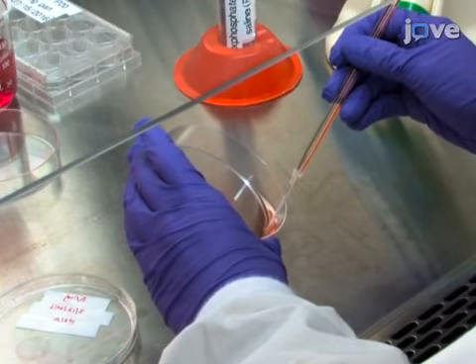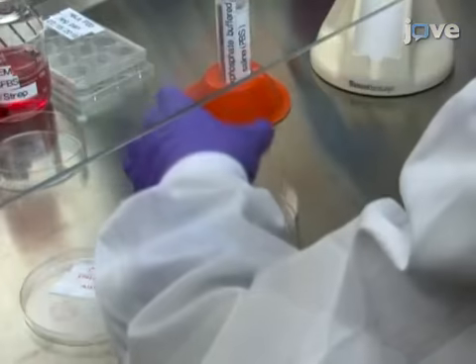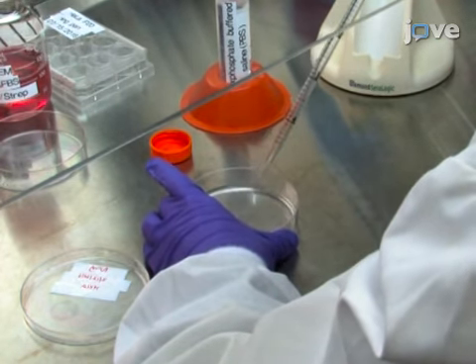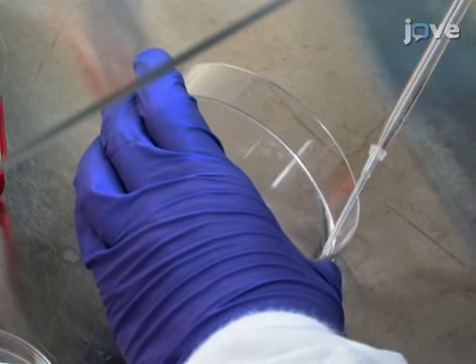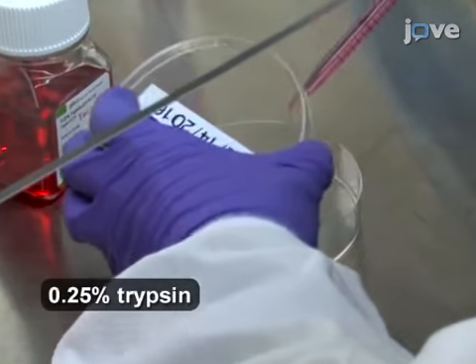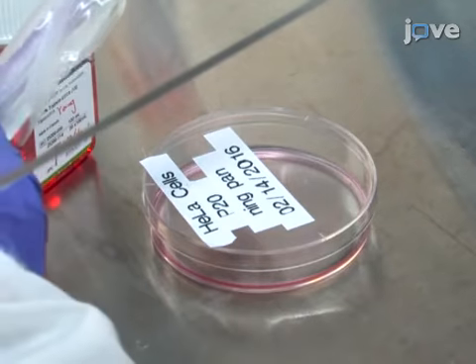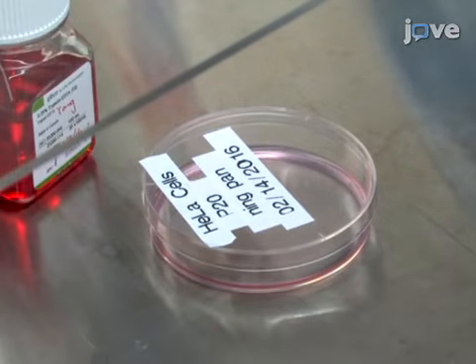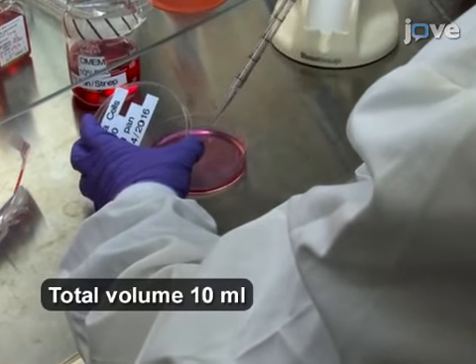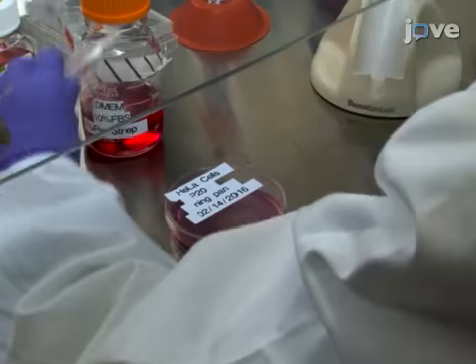Perform cell passaging in the cell culture plate. To do so, aspirate the growth medium and rinse the cells with 5 milliliters of 1X phosphate buffered saline. Remove the PBS using a sterile aspiration tip and incubate the cells with 2.5 milliliters of trypsin for approximately 5 minutes at 37 degrees Celsius to detach the cells from the culture plate. Stop trypsin activity by adding 7.5 milliliters of complete cell culture medium and then uniformly resuspend the cells.